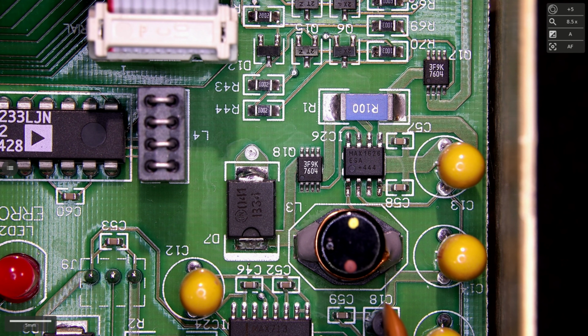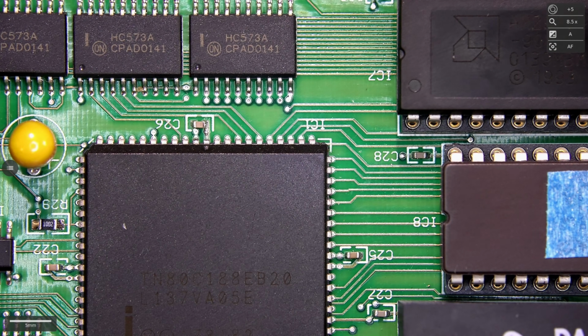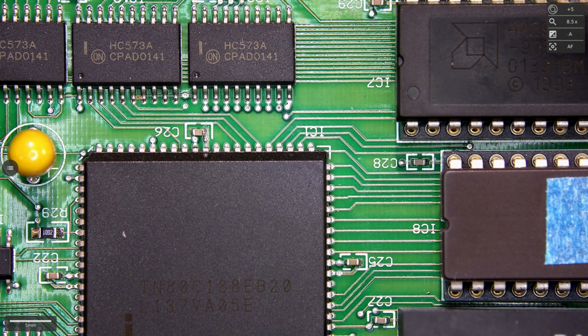Well, first thing first, let's power this on, make sure the 5-volt supply is actually there, and if it's drawing a reasonable amount of current, then we can turn our attention to the rest of the stuff, which is all the way on this side. Things like our main processor and everything else. I hope that these things have actually survived, but anyway, we'll have to try to find out.